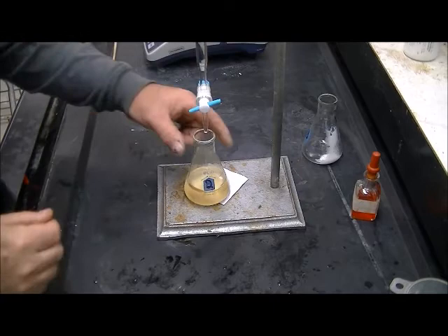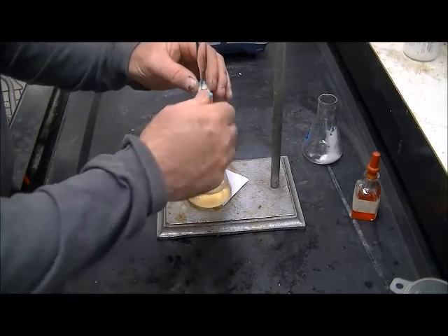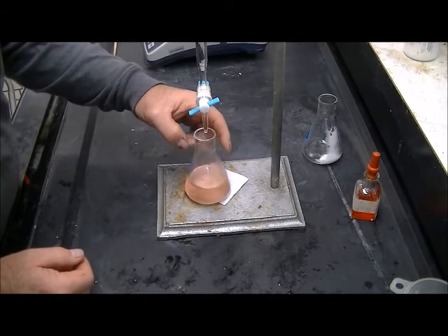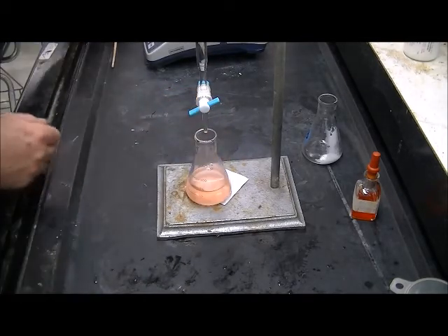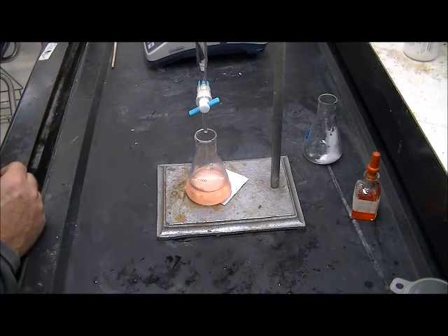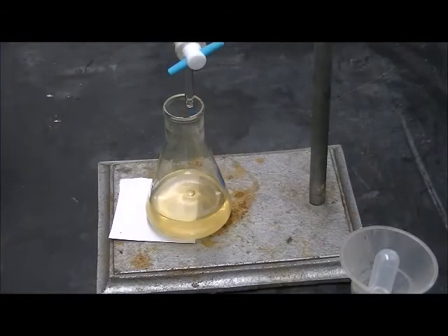And this is C, sample 2. And the reading is 34.5 milliliters.